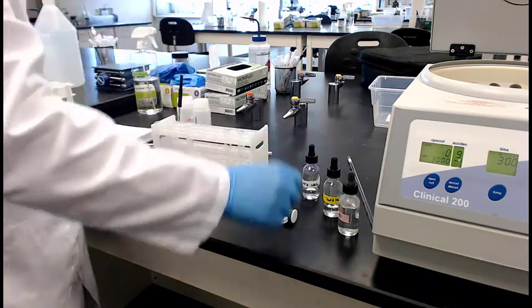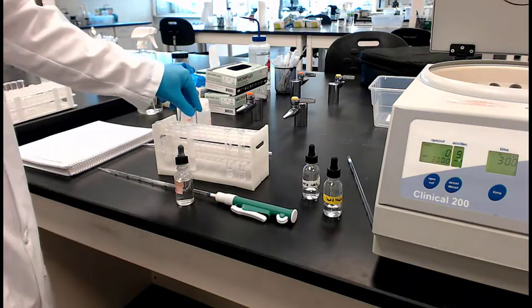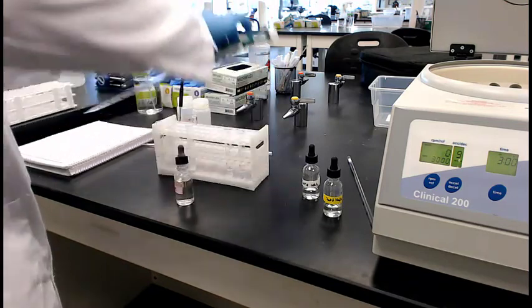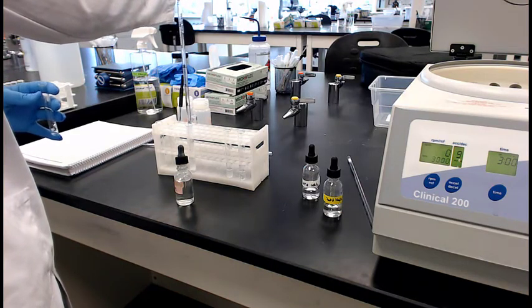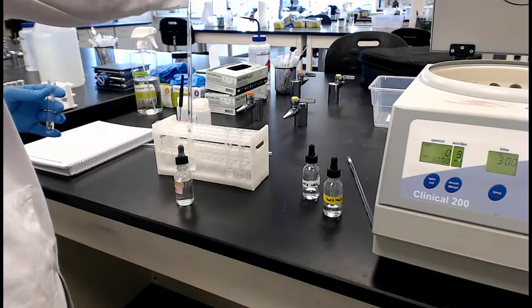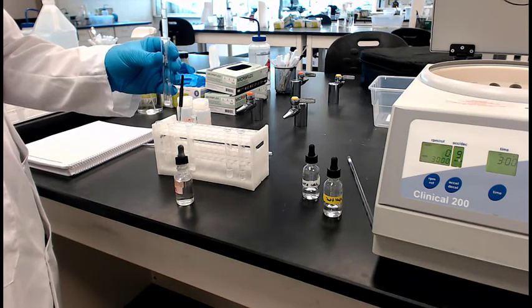And to the other one, so now we're going to work on the other tube, but first he made a little mistake, so he's going to redo this. He's going to get some of that clear fluid and put it back in another tube. Again, that's step 4 where he split it into 2 tubes. He's just going to redo that. He had enough clear fluid left over, he can do this. So he's going to put that in the tube if he can. There we go. So it's still fairly clear. Good.